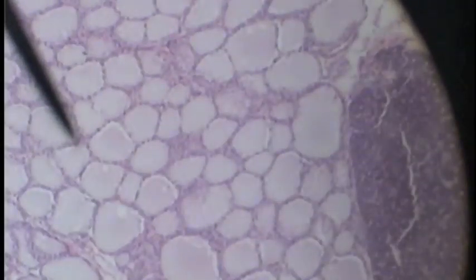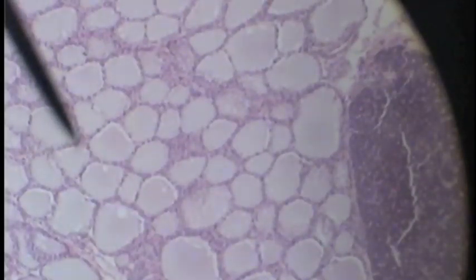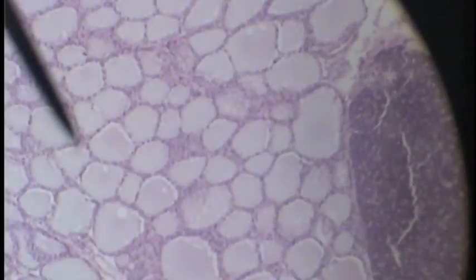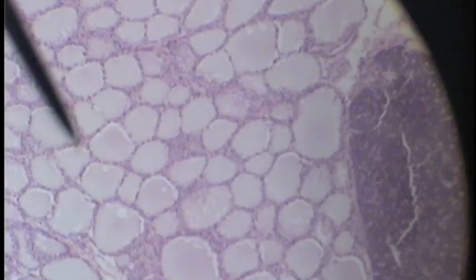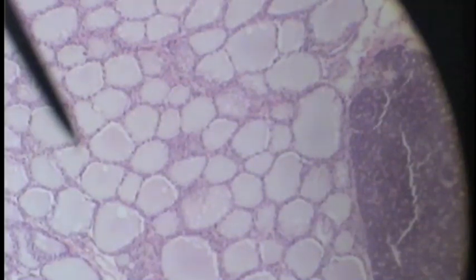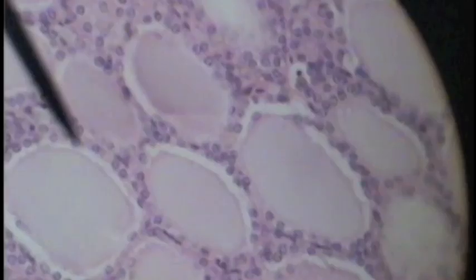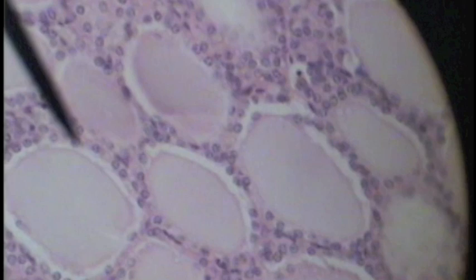On low power we can see the follicles that make up the thyroid gland. To the right you can still see the parathyroid gland. Here we are on high power looking at the follicles that make up the thyroid gland.